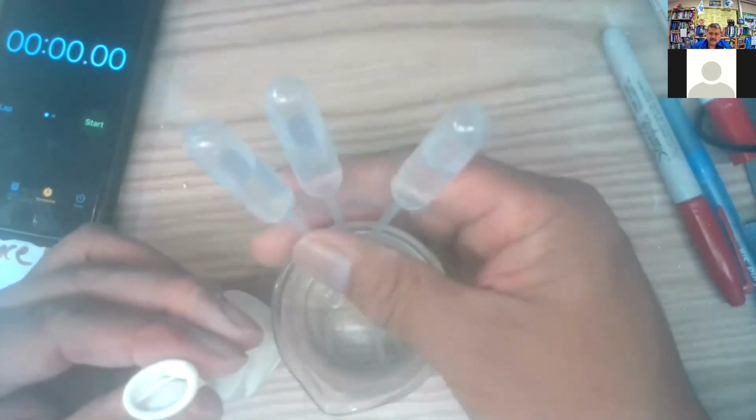I need my water's preloaded for 3, and hopefully I can do this much quicker this time. Maybe I'll do 3 like this. And let's squirt it in and do this. Get the 2. Okay, ready? Let's do that. 1, 2, 3.